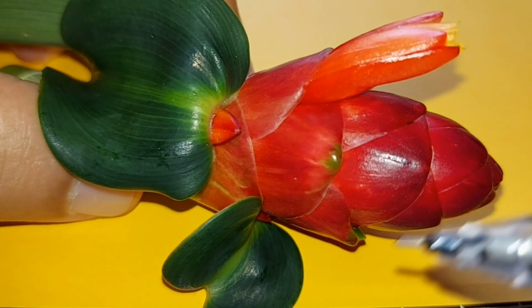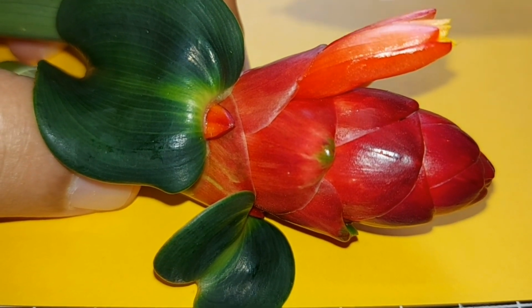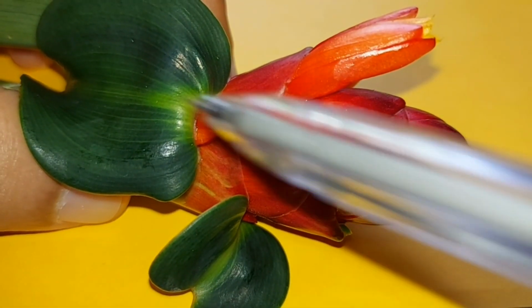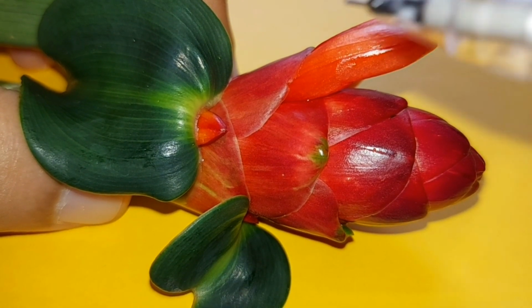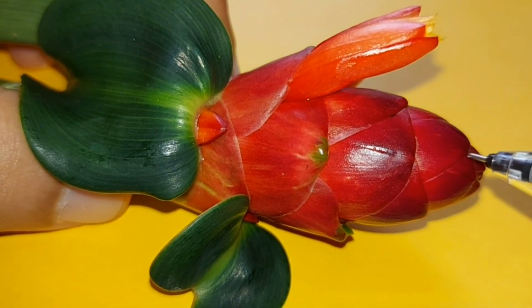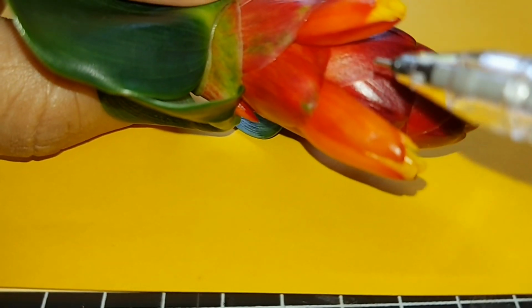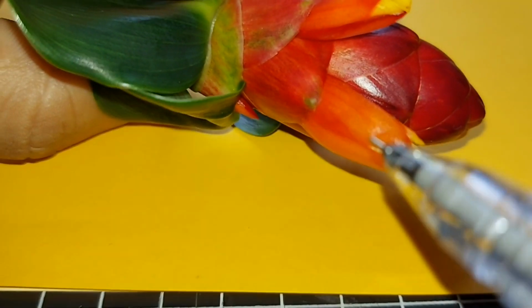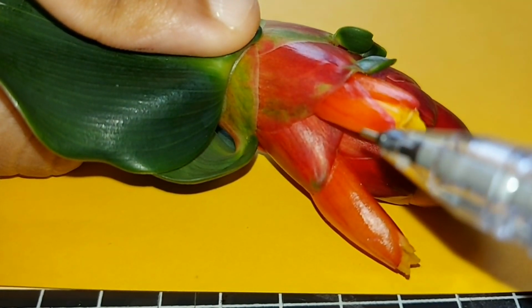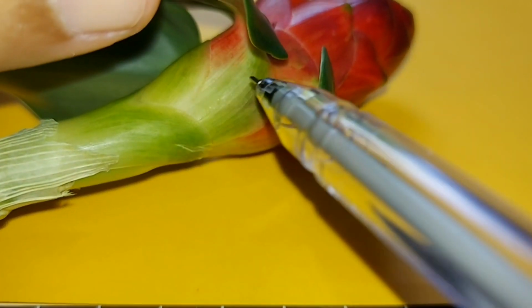Okay, I have another type of flower here. This is actually insect pollinated as well because of the sheer size of the flower. Now this kind of bud is actually quite special because from each individual scale you'll have one flower growing out. For example, like this, you see one flower is growing out from here. Okay, then another one from here, and if you're wondering where the sepal is, it is actually down here.